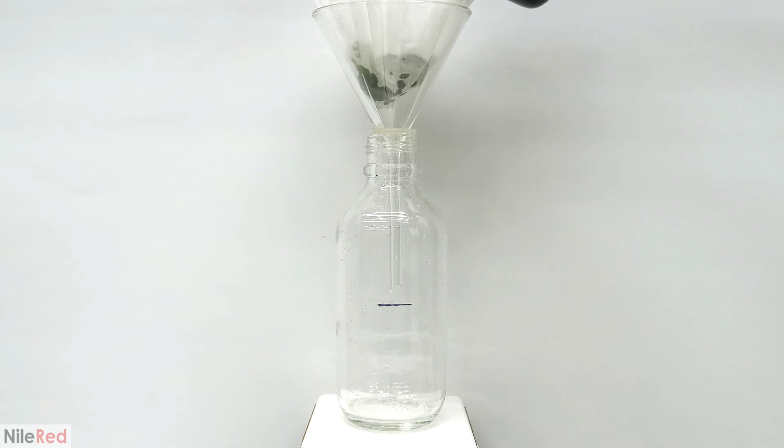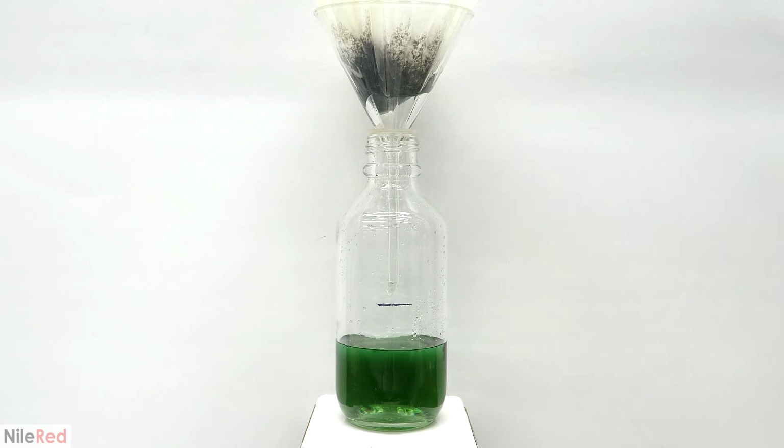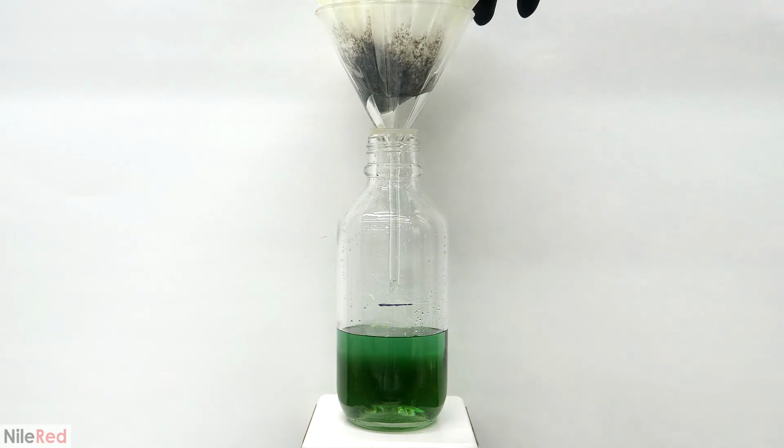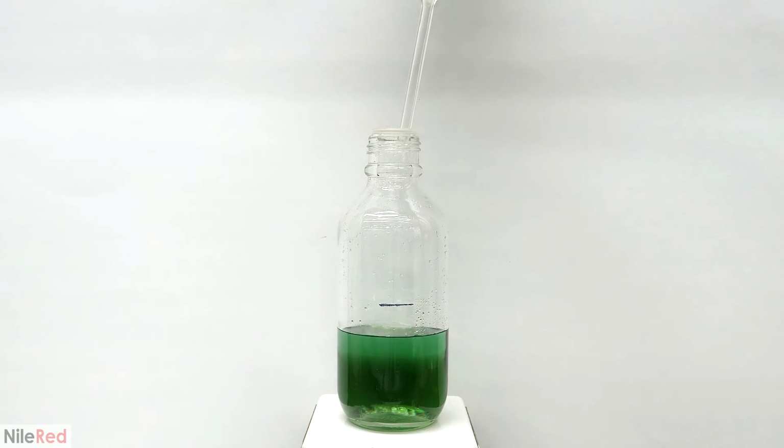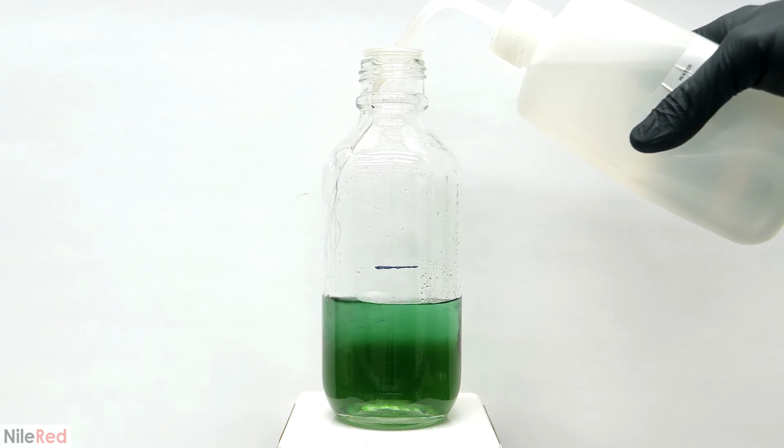I did this by just passing it all through a regular coffee filter, and I drained it directly into the bottle that I was going to store it in. When everything had filtered through, I washed the beaker, the steel wool in the filter, and the filter itself with a bunch of distilled water. When I was done doing that, I took away the funnel, and I topped everything off with more distilled water until I got to the level that I pre-marked on the bottle.